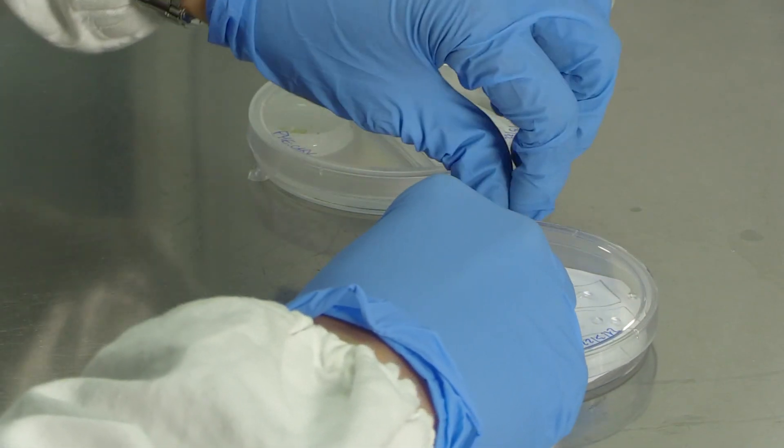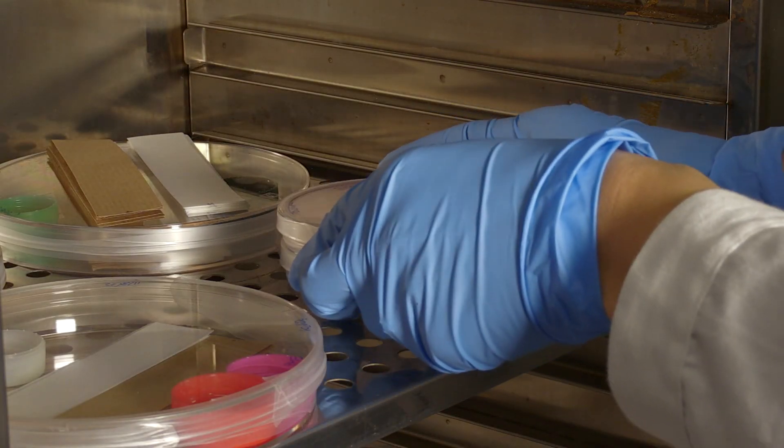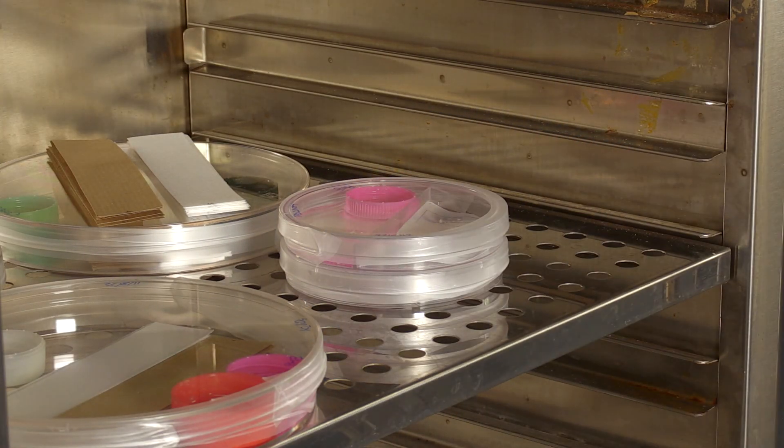The petri dishes must be sealed to prevent possible contamination and placed at 27 degrees Celsius for incubation.